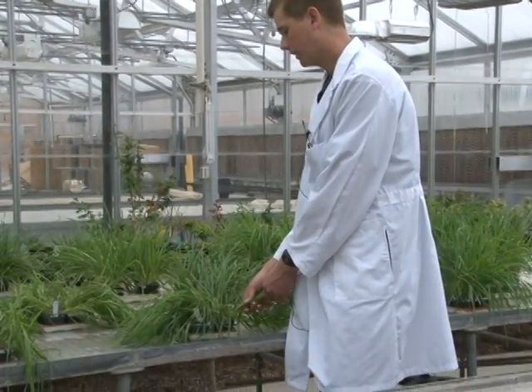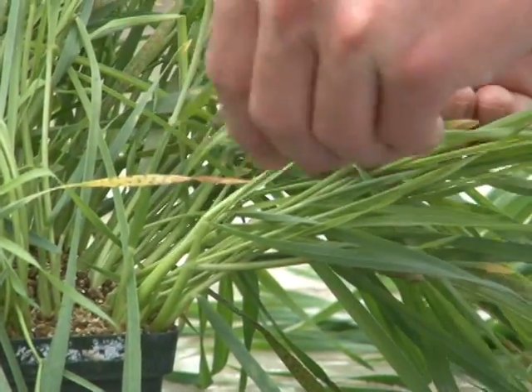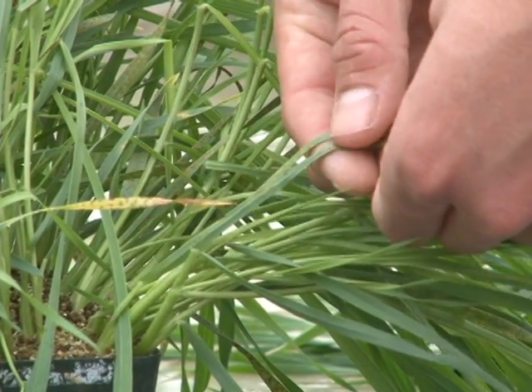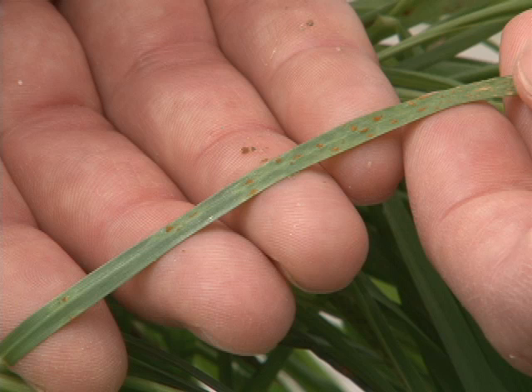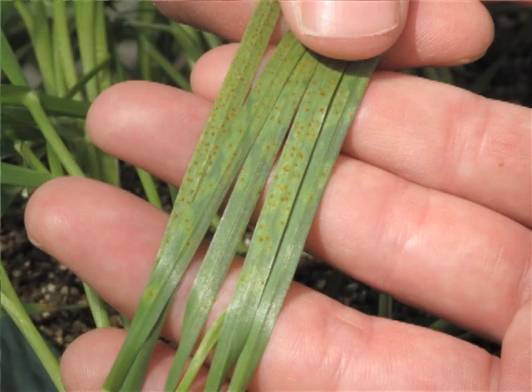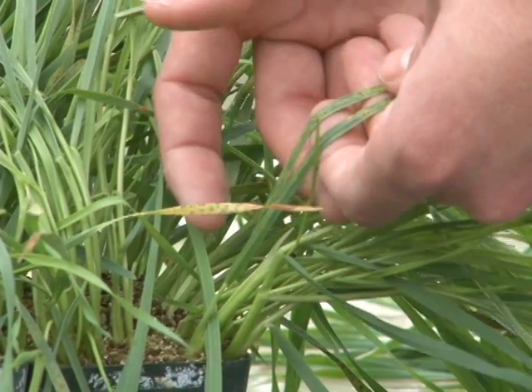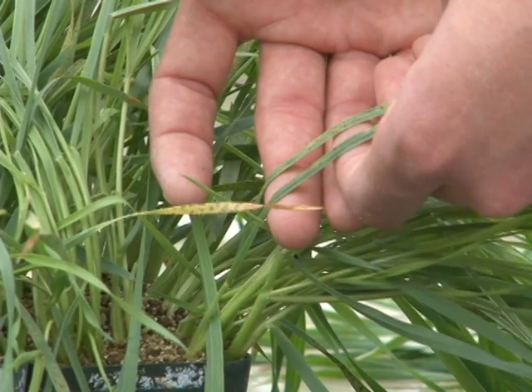Now I'd like to describe the difference between plus and minus. On the zero to four infection type scale, you can add plus and minus signs to be more descriptive. As an example, this monogenic line has the stem rust resistance gene SR7B. When inoculated with QTHJ, you can see the round sporulating areas and the green islands, which are indicative of a two infection type. However, compared to the SR24 monogenic line, these sporulating areas are larger. This quantitative difference — still being a two but with larger sporulating areas — leads us to classify this as a two-plus infection type.